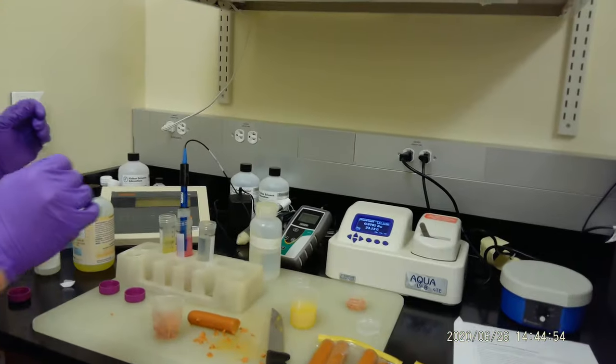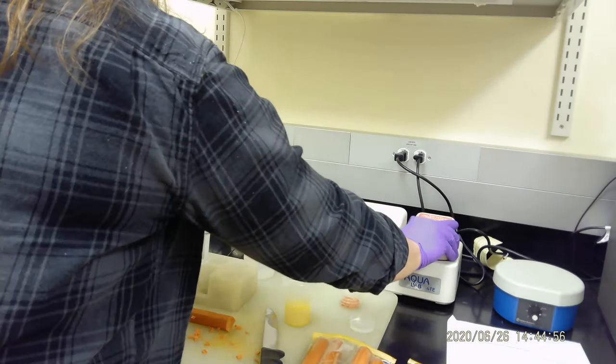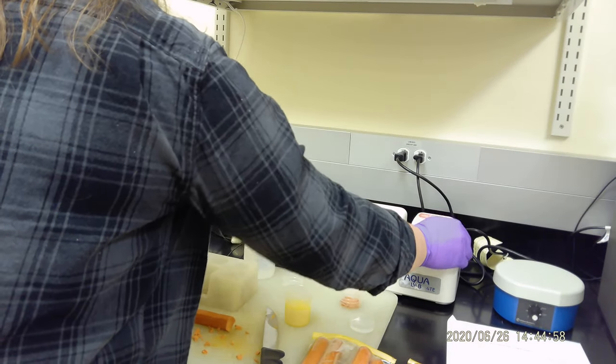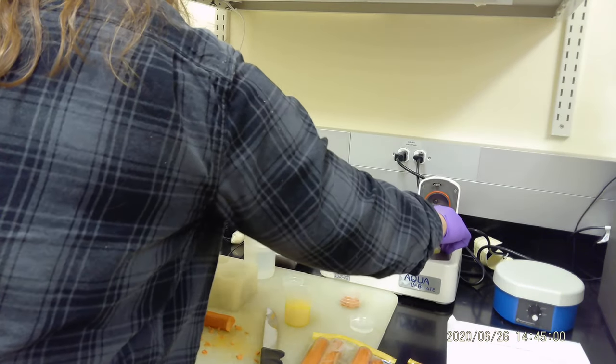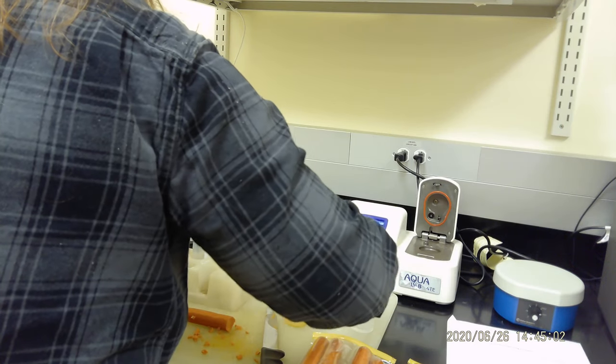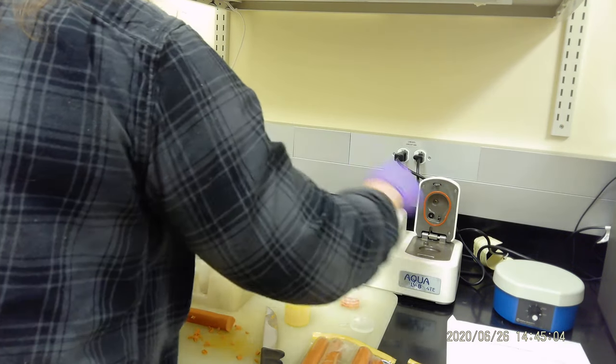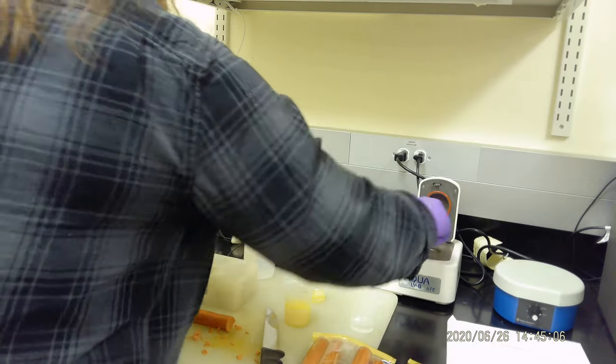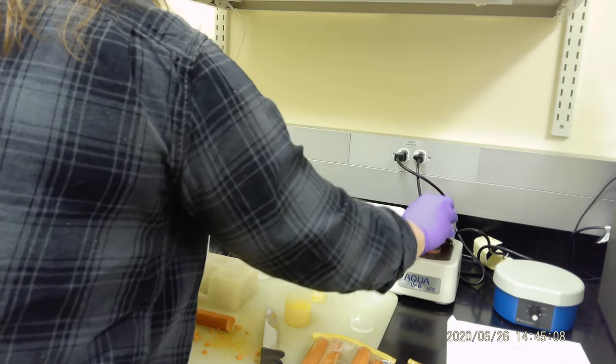Okay, what is the number for that? You see that number is lower—that is 0.9792 at 23.1 degrees Celsius. So Casey, we can go ahead to do the hot dog. The pure water here we measured 0.9885, and the juice is 0.978, so that's lower.